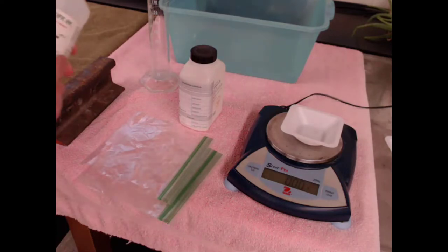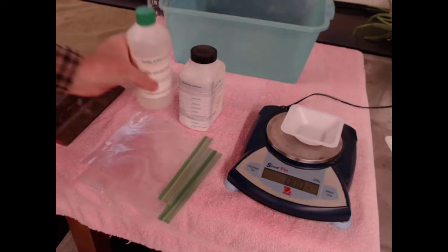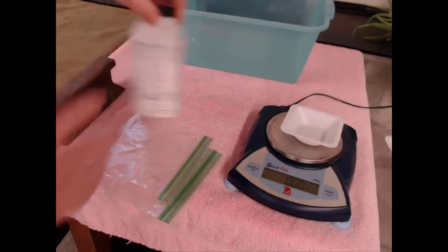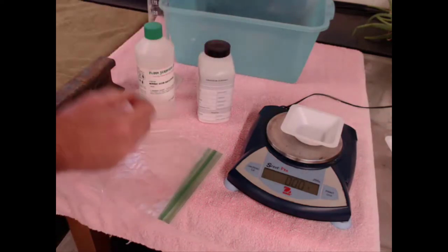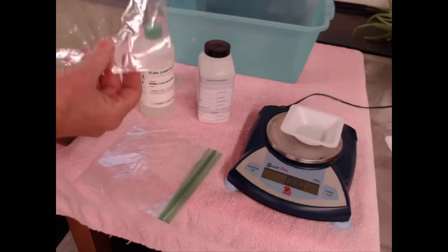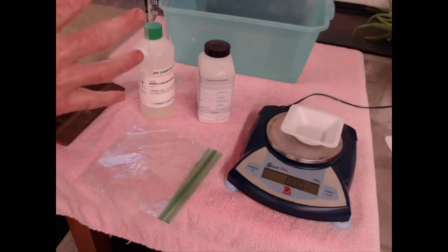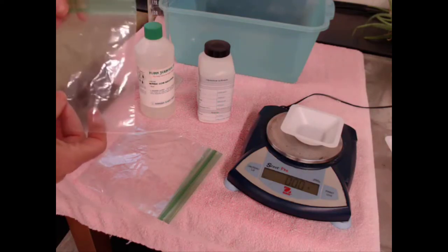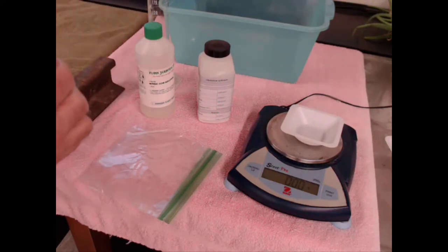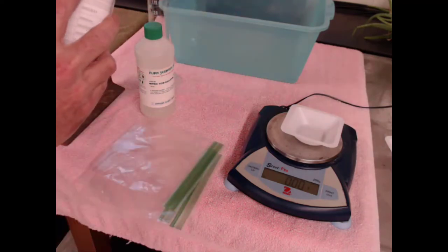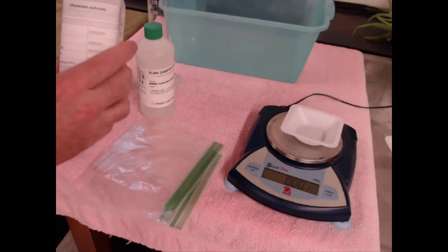Hi guys, today we're going to mix together a couple of compounds: nitric acid and aluminum carbonate. This should generate some gas, and I'd like to get this bag to plump up perfectly. Then your job is going to be to figure out how much aluminum carbonate Jerkins actually put into the bag to make this react.